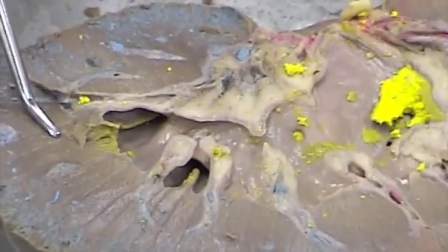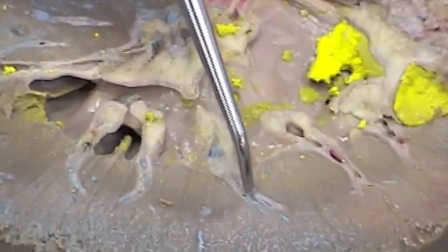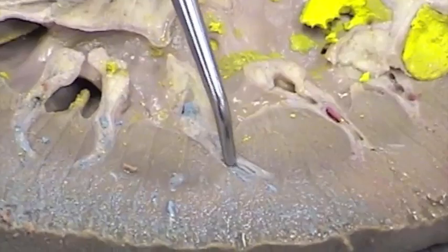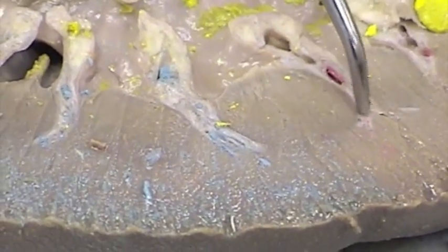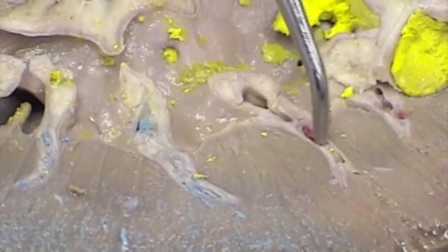In between the renal pyramids are what are called renal columns, and within the renal columns we find blood vessels. Here's a pyramid, here's a pyramid, and here is a column with some blood vessels in it. The column is an extension of cortical tissue that extends between the two pyramids.